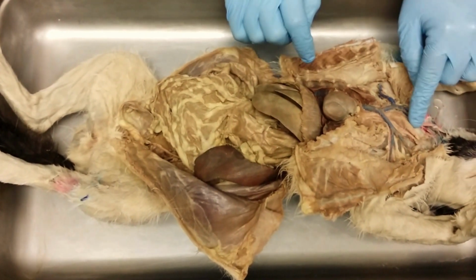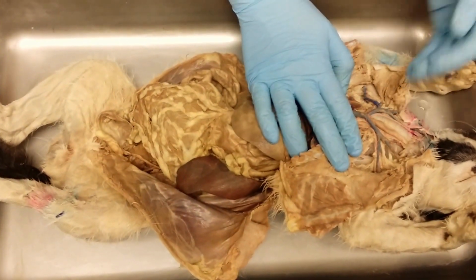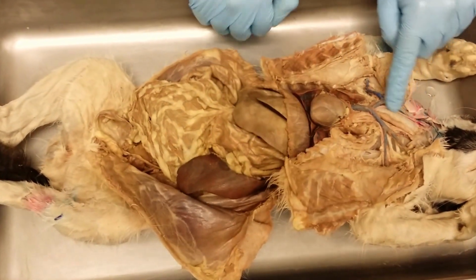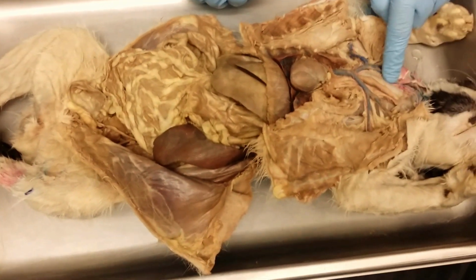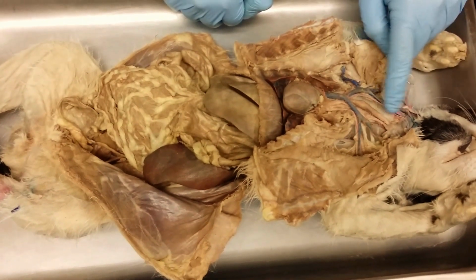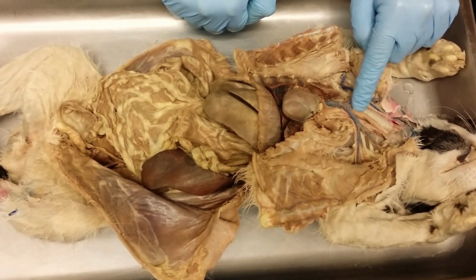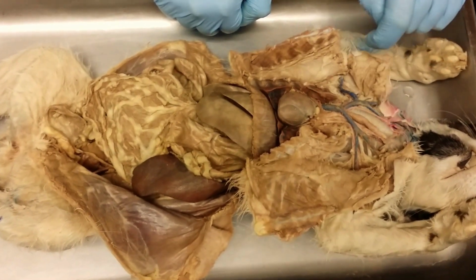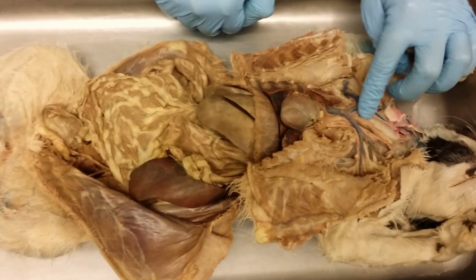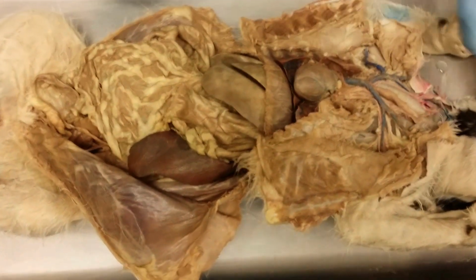But on the cat, you just need to be able to identify this esophagus. So the esophagus lies on the posterior side of the trachea. So this tube right here, I know it's the trachea because it's more sturdy. You see those cartilage rings. So this is the trachea, which is in respiratory. But right behind it, on the posterior side of that trachea, is this muscular tube called the esophagus. The esophagus will run parallel with the trachea down on the posterior side of the thoracic cavity.